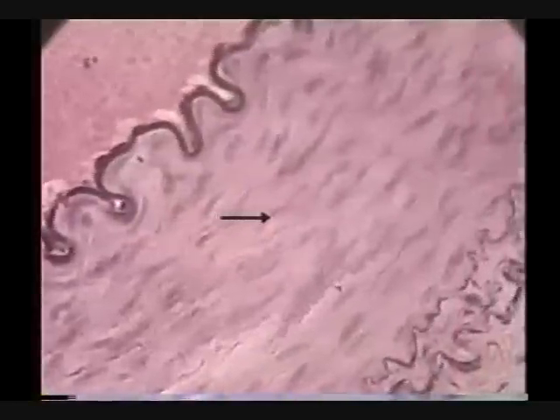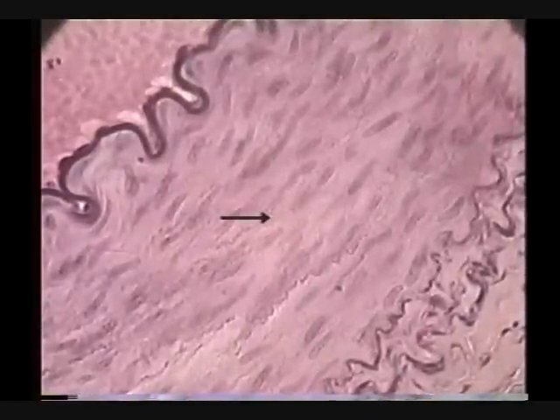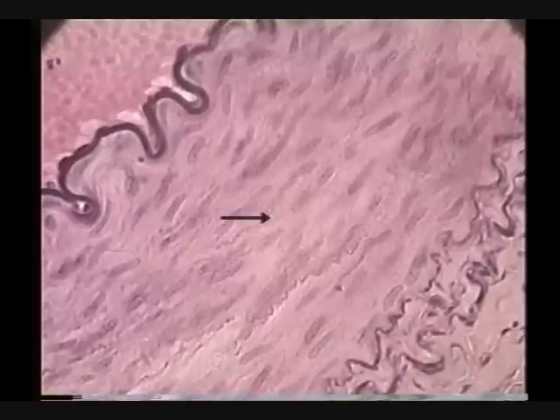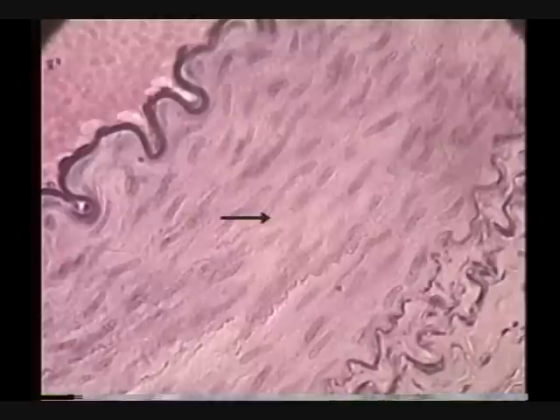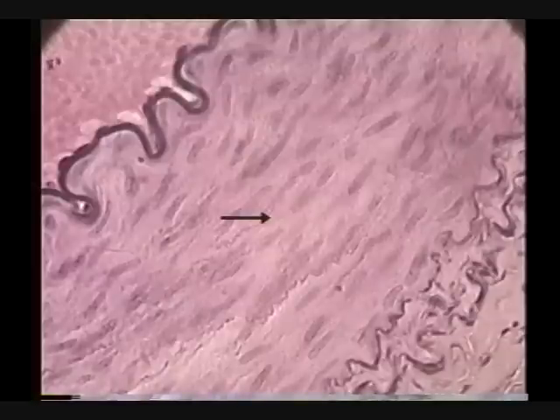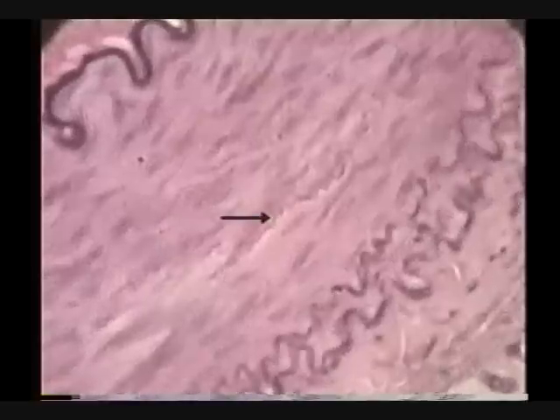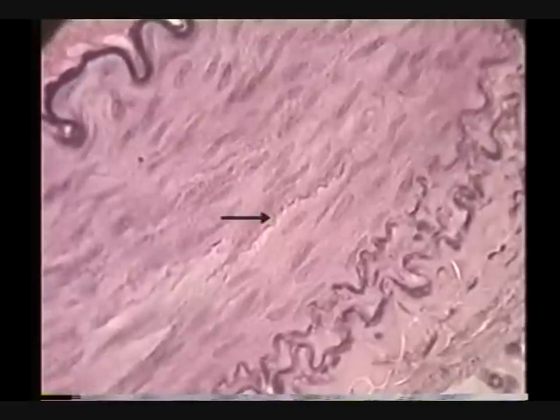Identify the tissue occupied by the pointer. The tissue is smooth muscle — look at those nice, long cigar-shaped nuclei. Very characteristic smooth muscle. What tunic are we observing here? This tunic is the tunica media. We see occasionally scattered in here a little squiggly line — that's an elastic fiber.